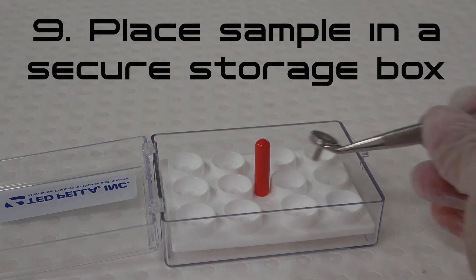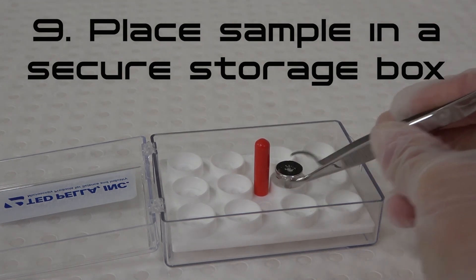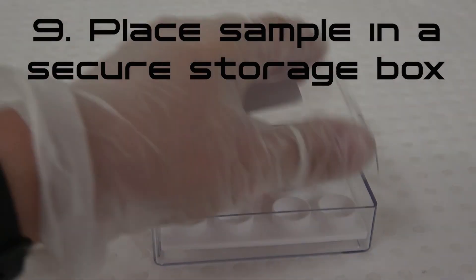Step 9. Place the mounted sample in a secure SEM storage box. Keep samples stored in a clean, dry environment.